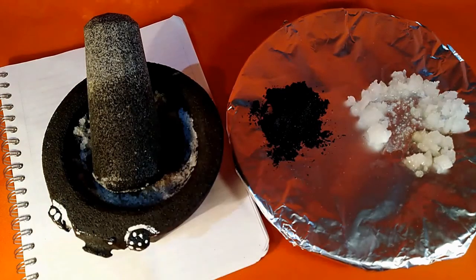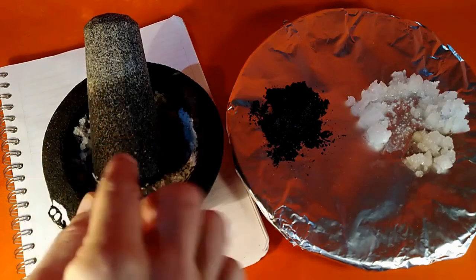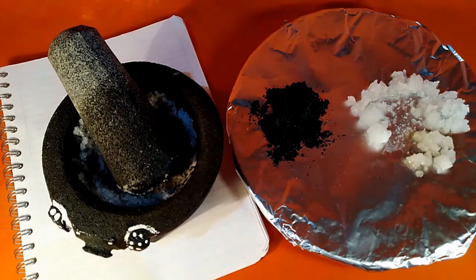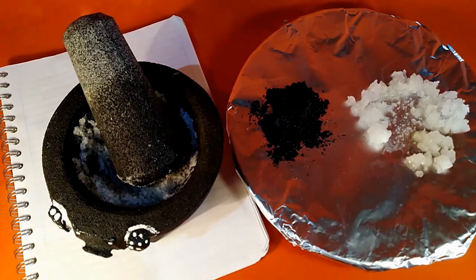I did this yesterday. I let it sit out. The mortar and pestle is wet. You can see that the water has soaked in to this part, up. The tip remains dry. This is, I believe, made out of a volcanic rock. It's really porous. And again, the salt absorbed water out of the atmosphere. The humidity condensed, wetting the salt, and the water proceeded to wet most of the mortar and pestle. And this all happened in some hours, less than a day for sure.